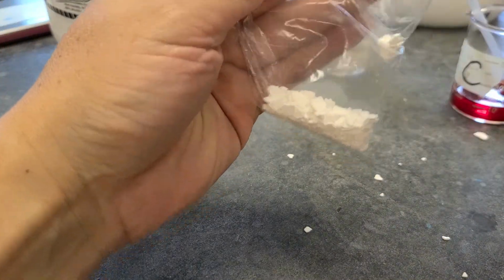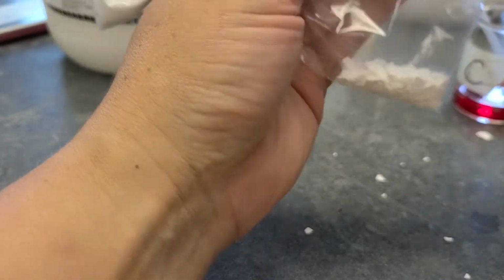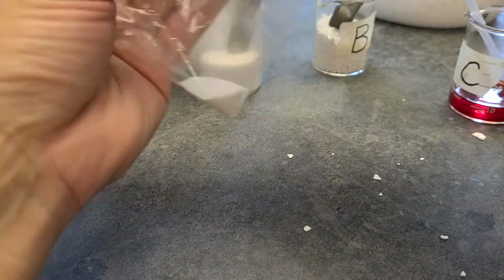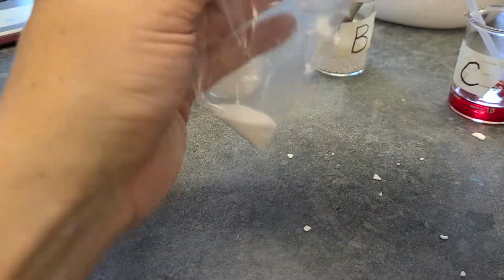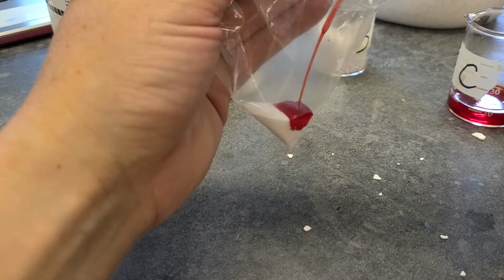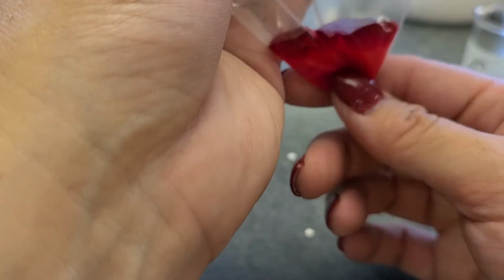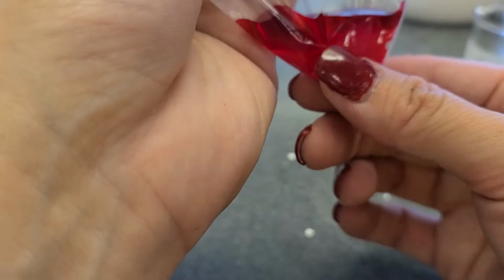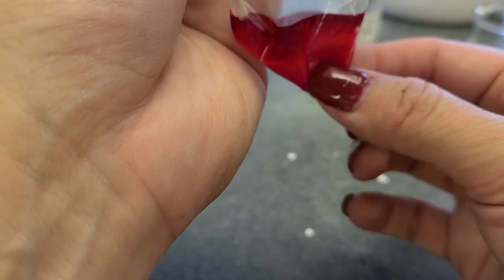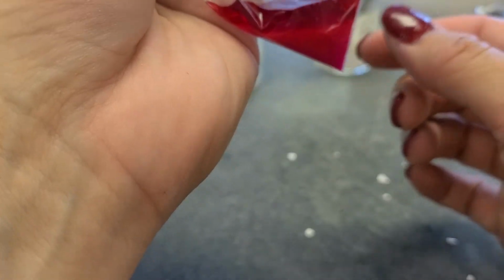The next step is to put some of substance C on one side and some of substance C on the other side, but not letting them touch. The first side I'm going to do is substance C with A. So look at your observation sheet and find C with A. Let's see what happens there. So there is substance A and C together. If you could feel it, the temperature is getting a little bit colder. Not really, but a little bit. It's not really doing much, but it does feel a little bit cold.